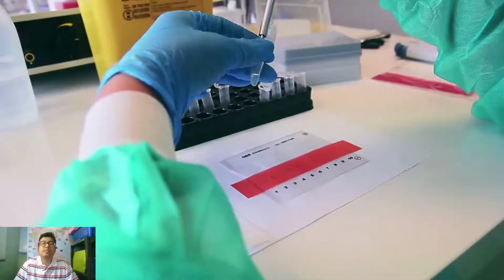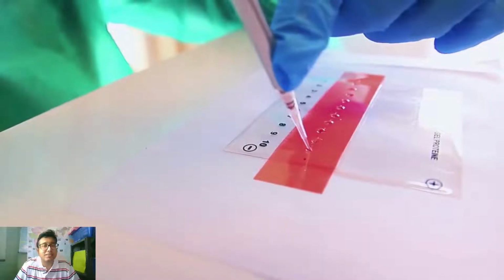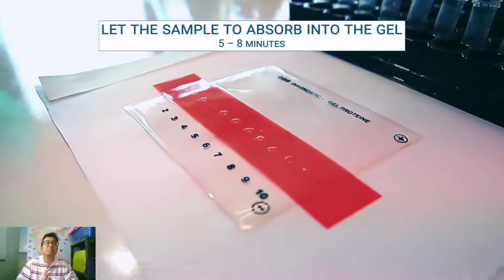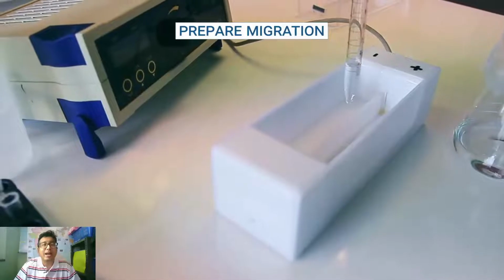So first they are applying the colorless samples. Mind it, they are not using dyes. Okay, in agarose gel I will be showing you that we are using dye. So the sample has been applied. Okay, we allow some time to absorb.